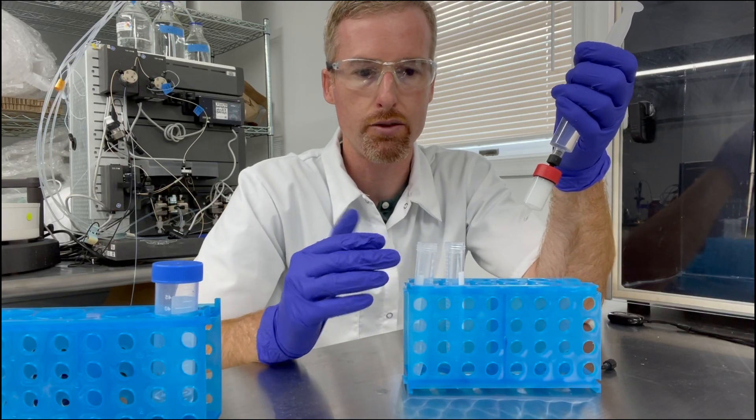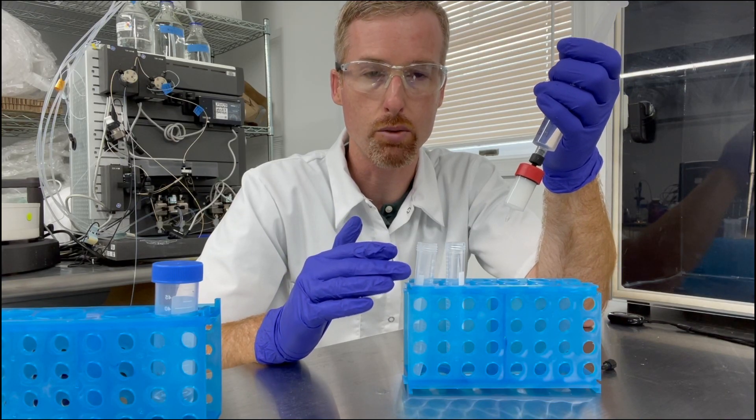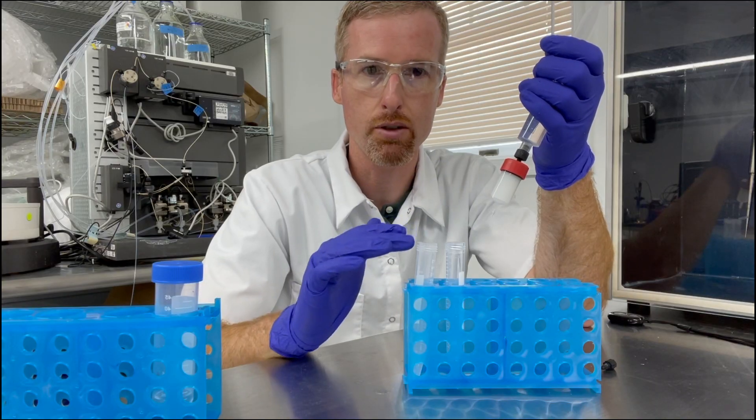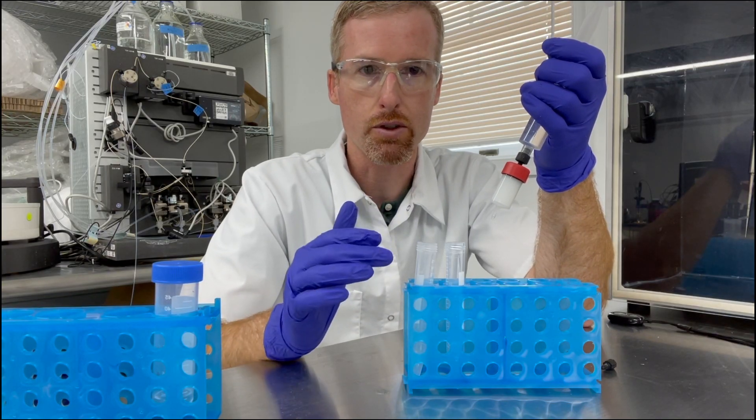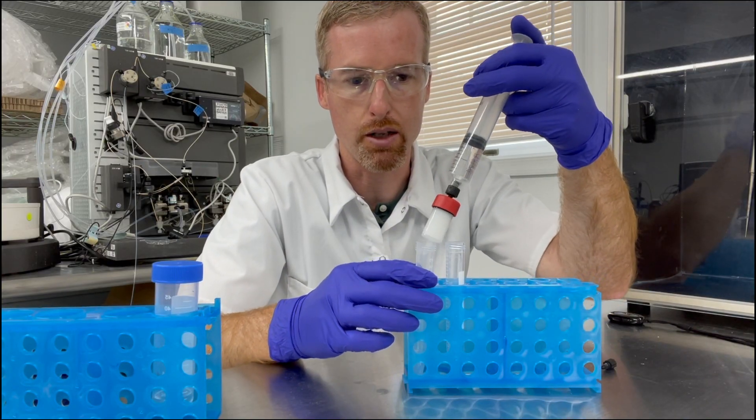I'm going to start off flowing into the waste tube for the first five mils because this is the buffer going through. After the first five I'm going to switch to collecting the protein in my other tube.